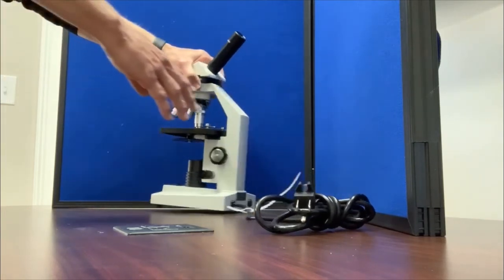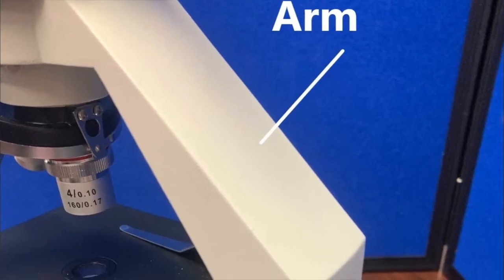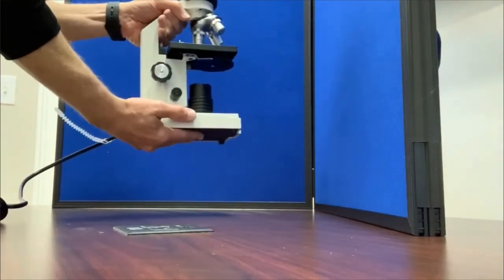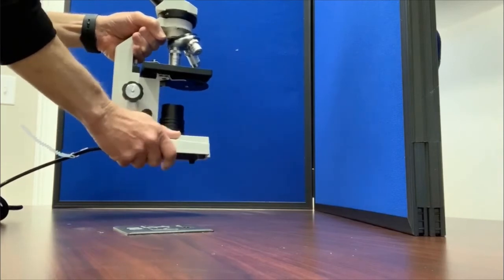This part of the microscope is the arm. It is used to move the microscope. You always grab by the arm, secure it with your hand under the base.